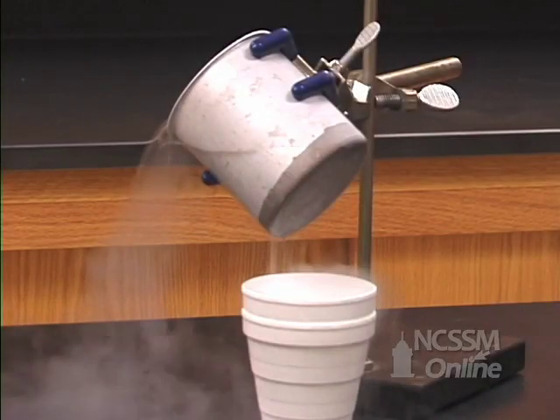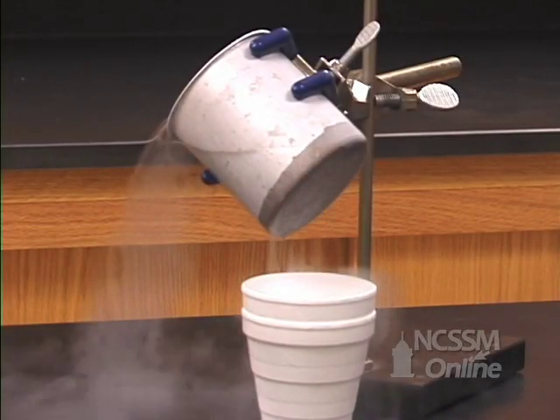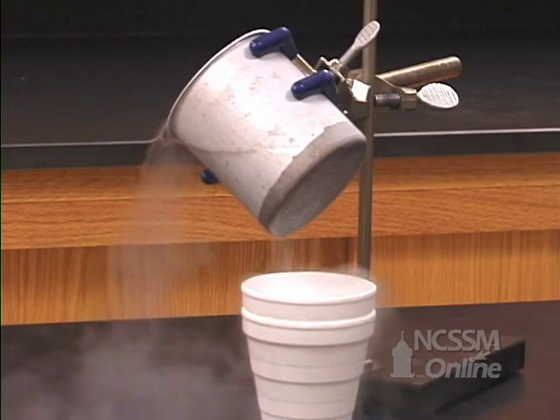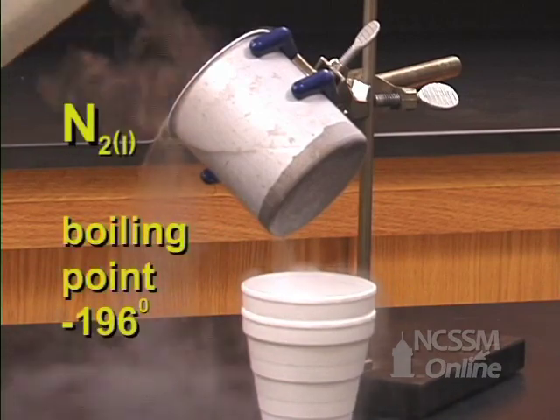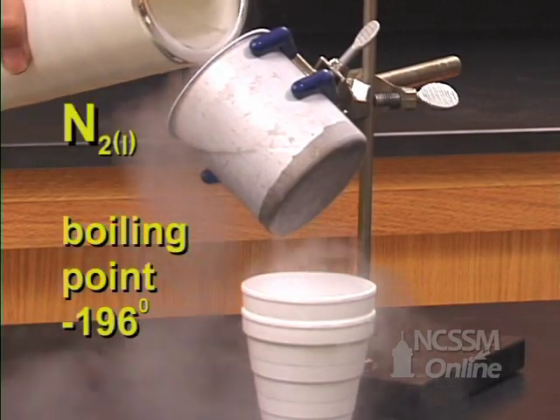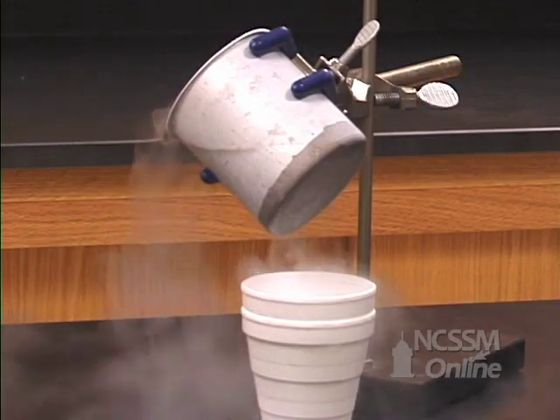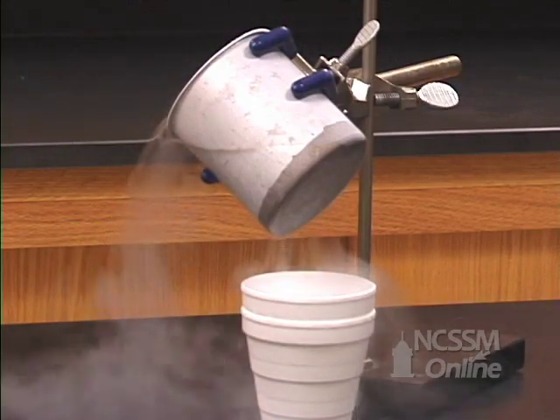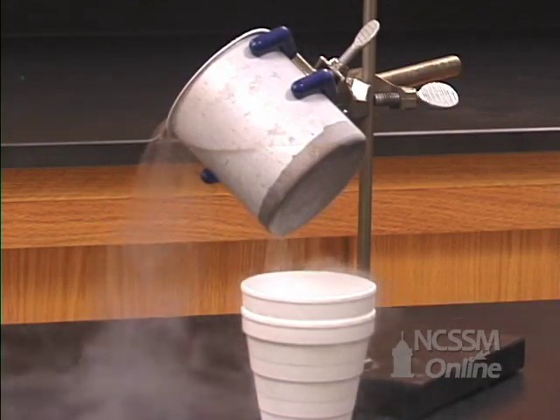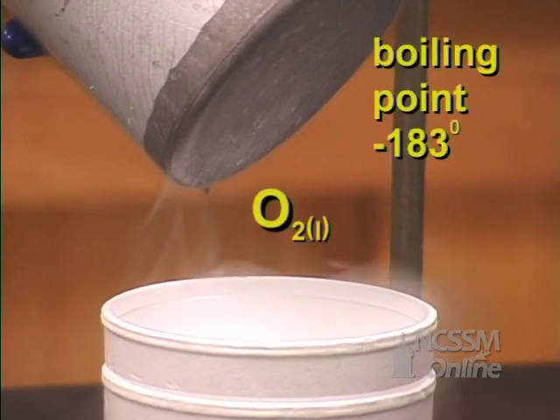Liquid nitrogen can be used to condense the oxygen from the air. Liquid nitrogen boils at minus 196 degrees Celsius, which is a lower temperature than the boiling point of liquid oxygen, which is minus 183 degrees Celsius.